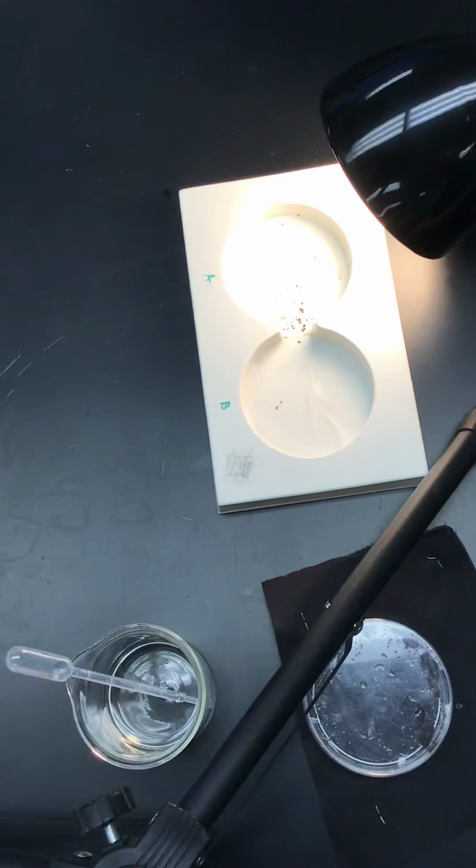So: if pillbugs prefer between a light and dark environment, then more pillbugs will choose the blank environment compared to the blank environment. And you put in what you think on those blanks. So let's scroll down and look at our lab. As you see, you had choices if you were here, but we are actually going to do the light versus dark.